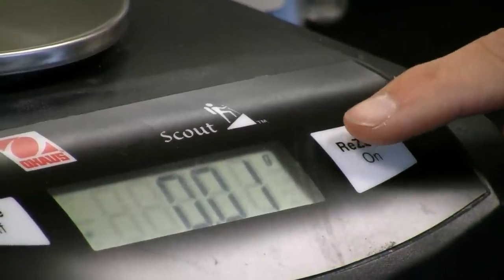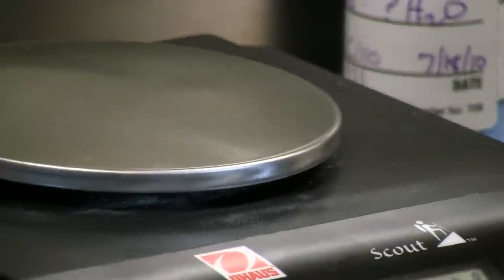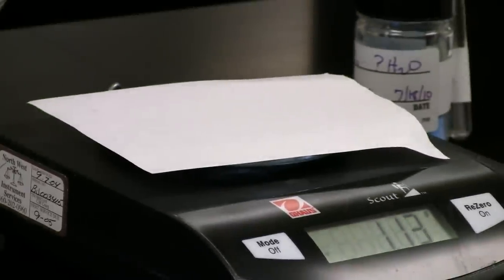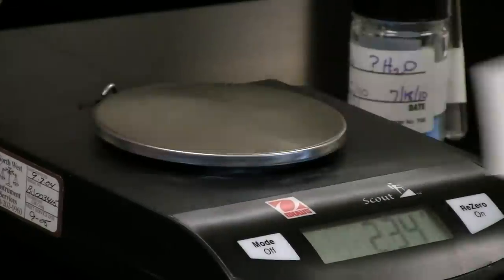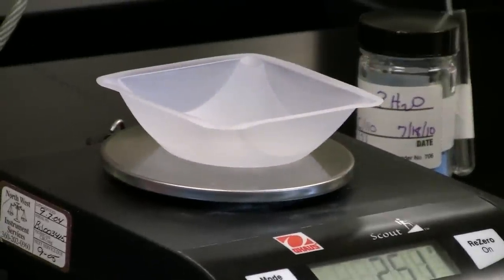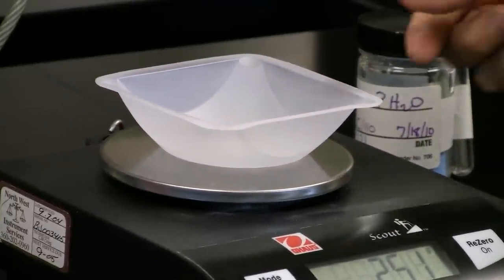Now, before measuring your sample, place a piece of weighing paper or a weigh boat on the balance to protect the surface. For most labs in your first term, weighing paper is just fine.